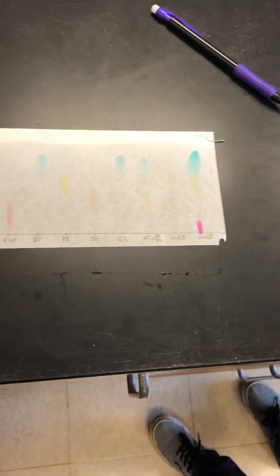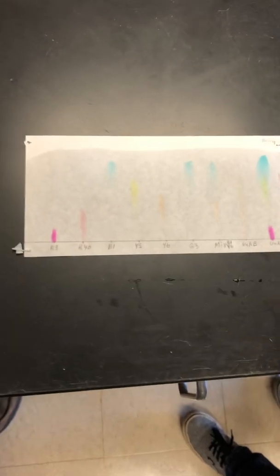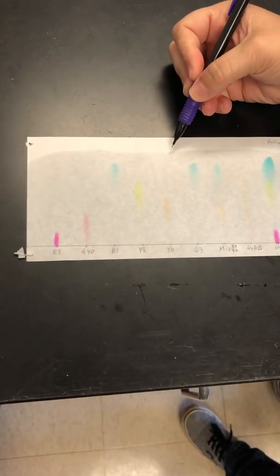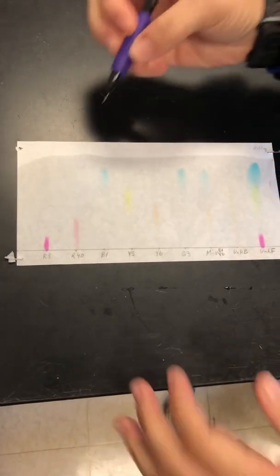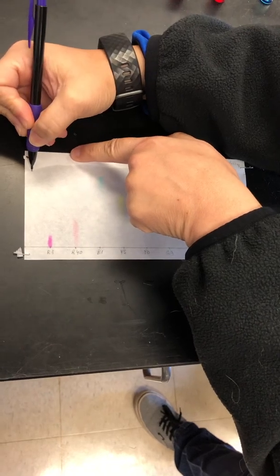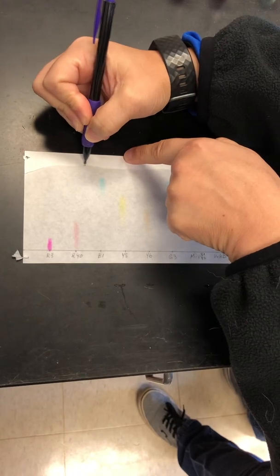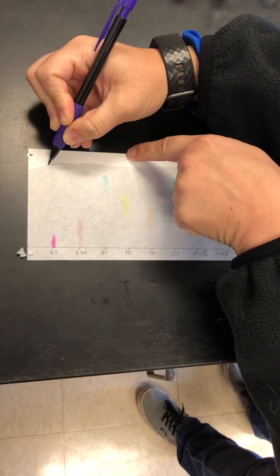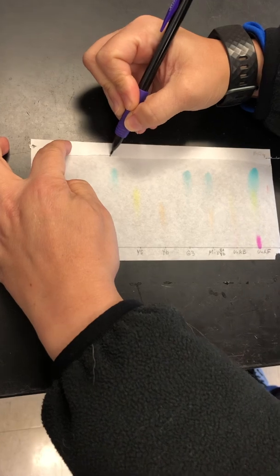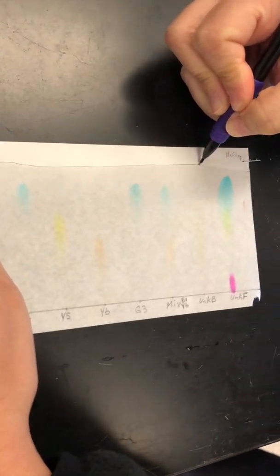So what we need to do is we need to draw what's called a solvent front. Because if I let this sit too long, I won't know where the line stopped. Where did my solvent stop? So literally you just trace the line. So let me put my finger on the paper. So you just trace exactly where the solvent stopped. So that's called our solvent front. Sometimes if you process your chromatography paper quickly, then you don't really necessarily have to draw the line because you did it really quick.